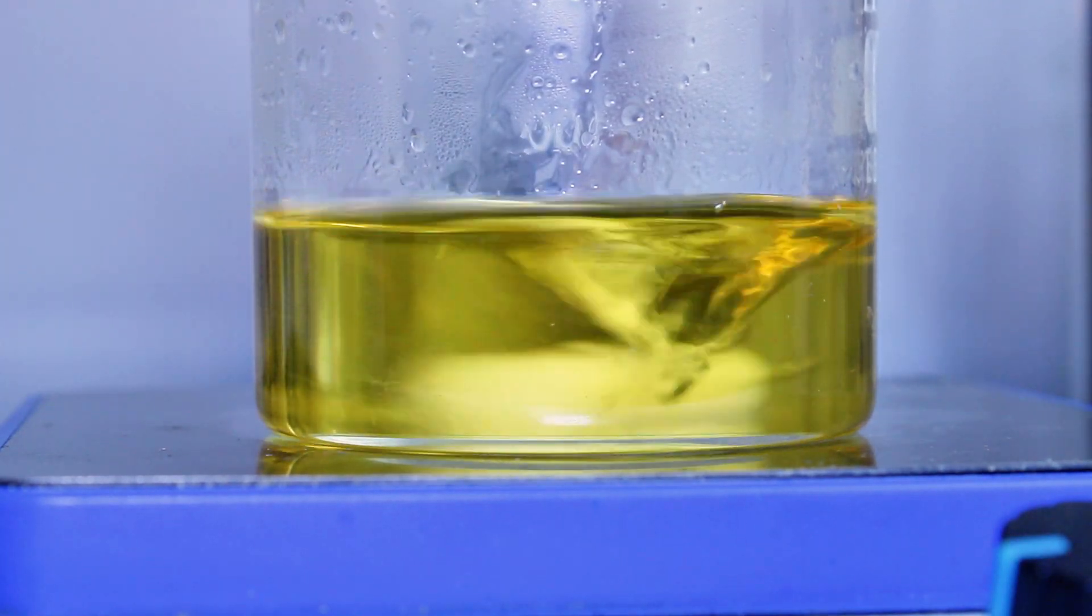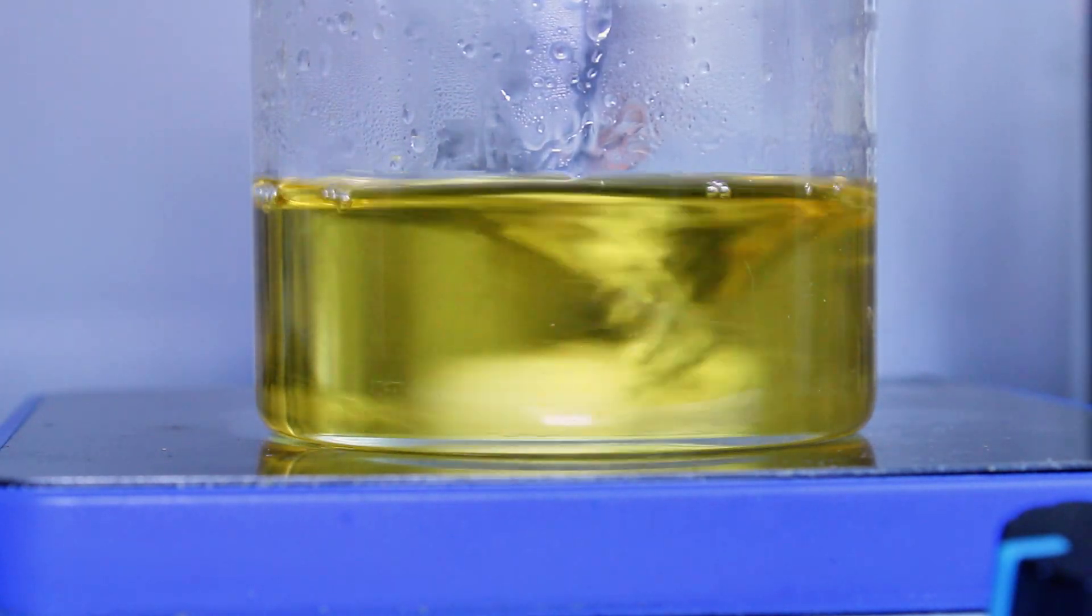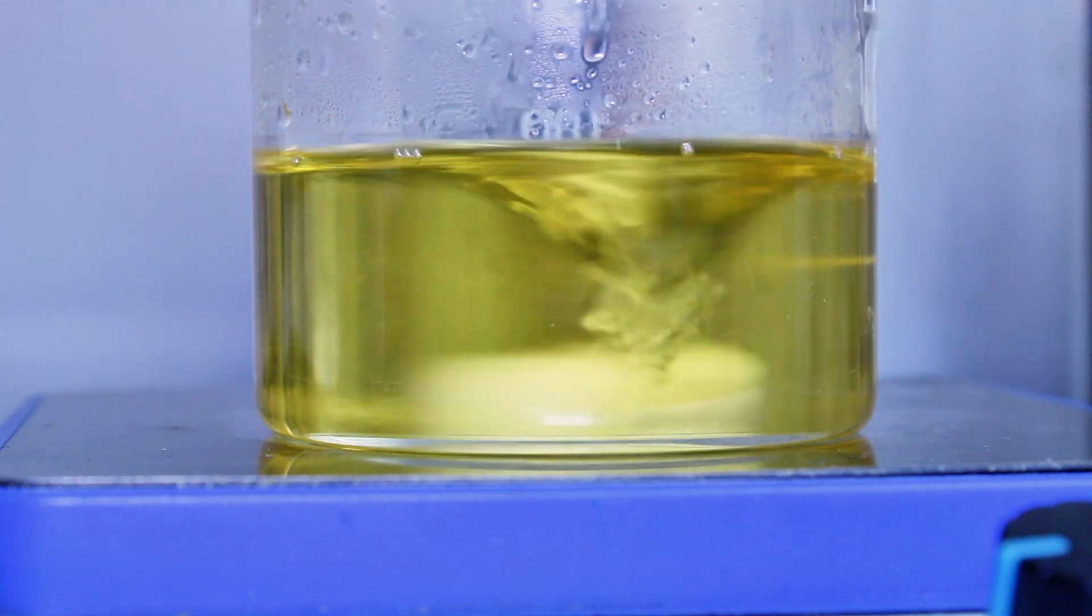And as you can also see, there is a distinct color change that results as the acid is added, but I honestly can't say whether that's typical as my aniline was a bit oxidized and therefore not entirely pure.